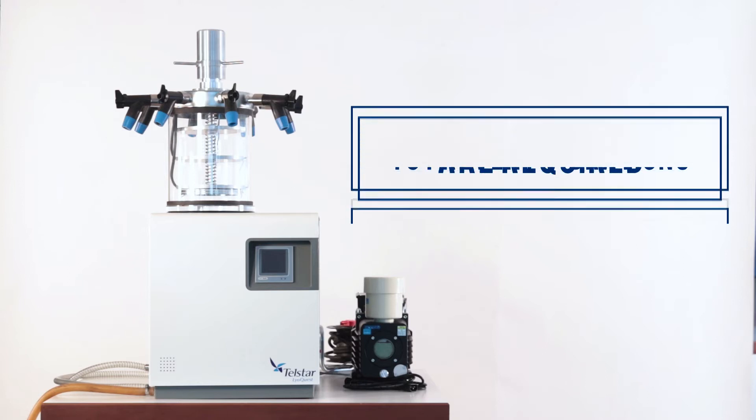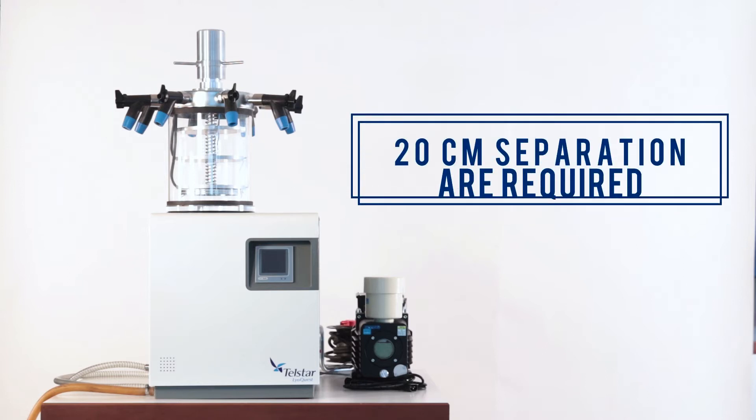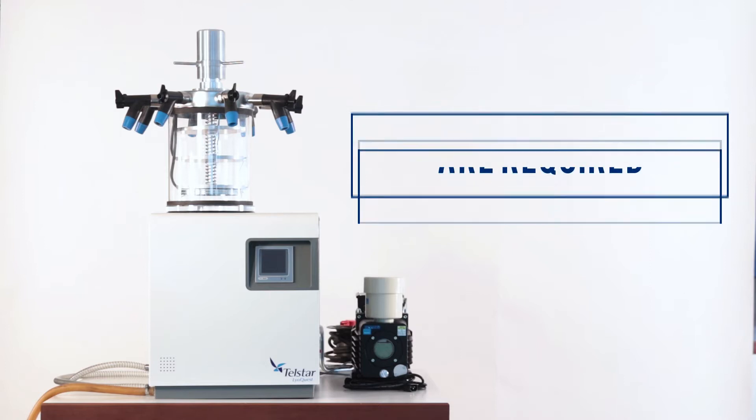In order to assure suitable refrigeration, all vents must be separated by at least 20 centimeters from other equipment or from the walls.